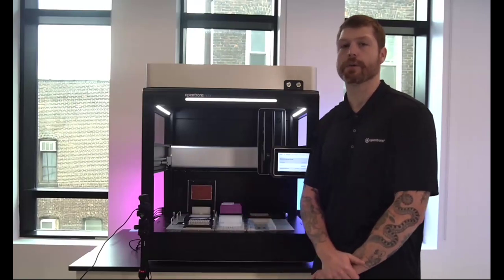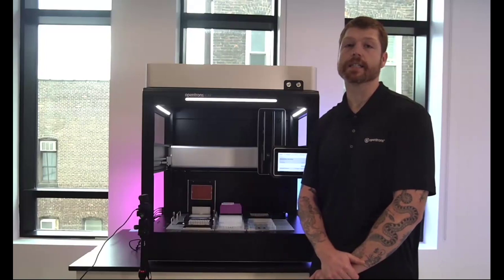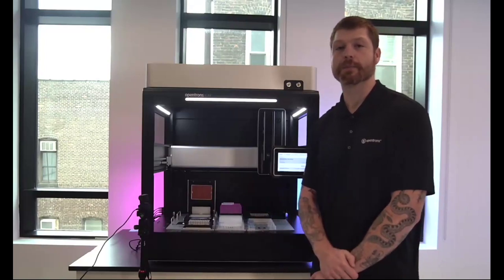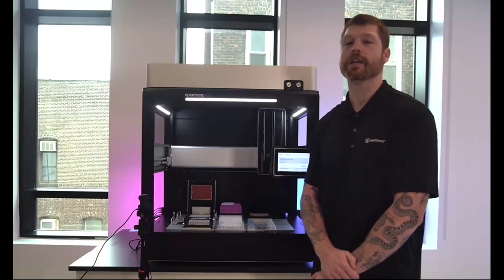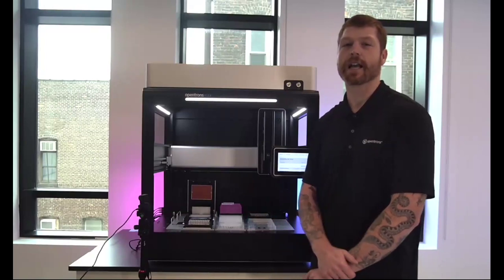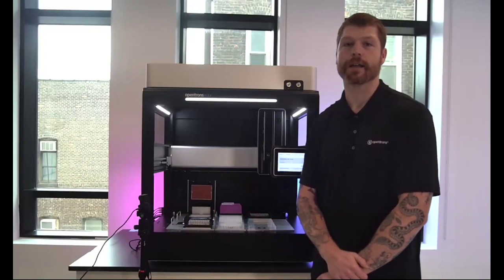Quick note on that. As you can see, there are 2 pipettes that are loaded currently. If the 96 head is loaded, you can only load that 1 head. But again, with partial tip pickup configurations, the flexibility really increases as you are able to use that in similar avenues to a single or an 8-channel pipette.